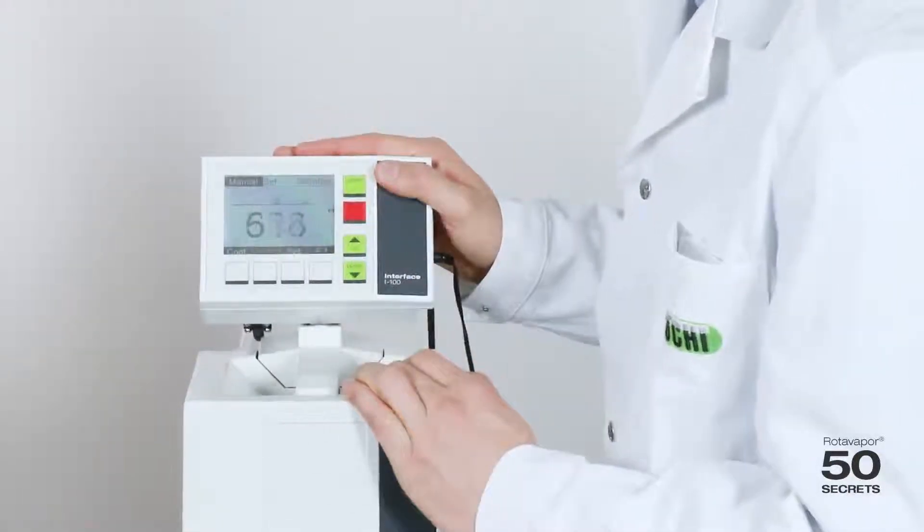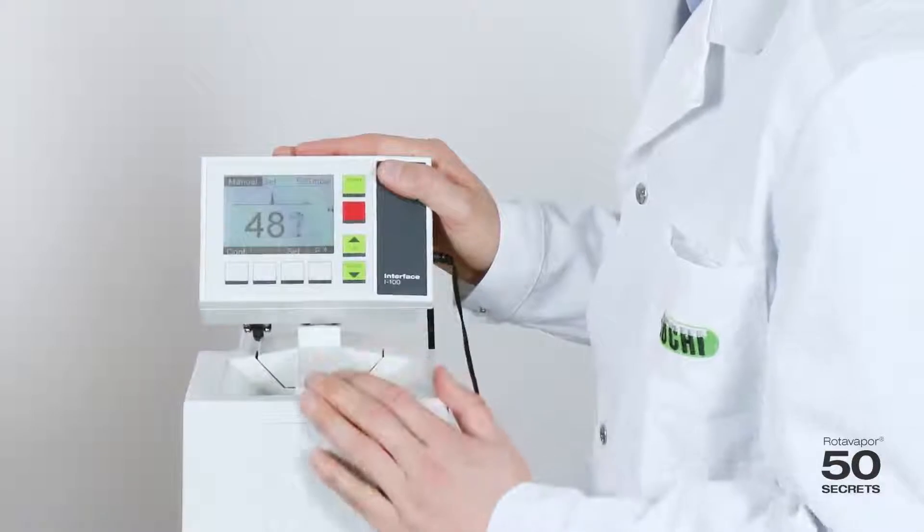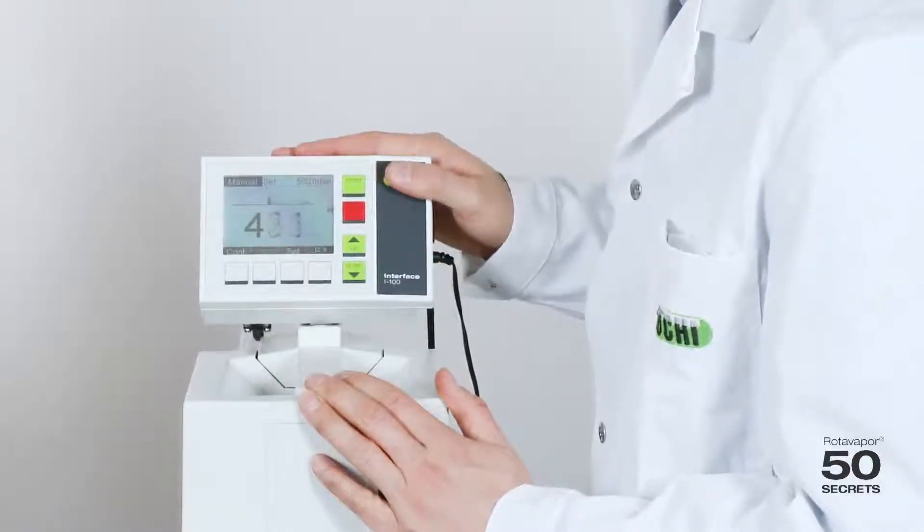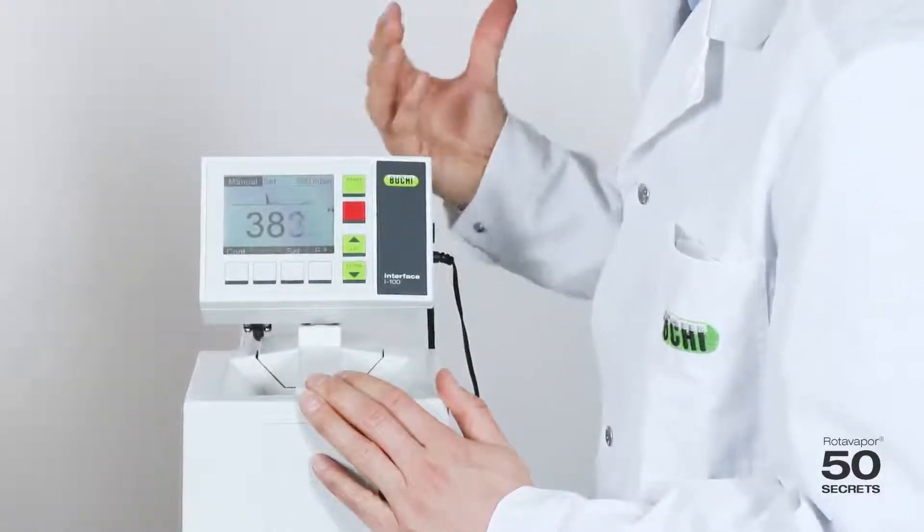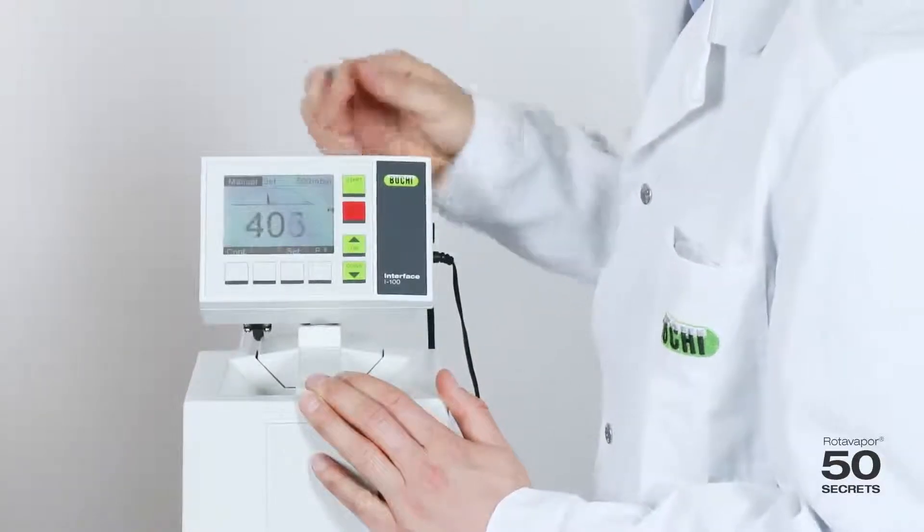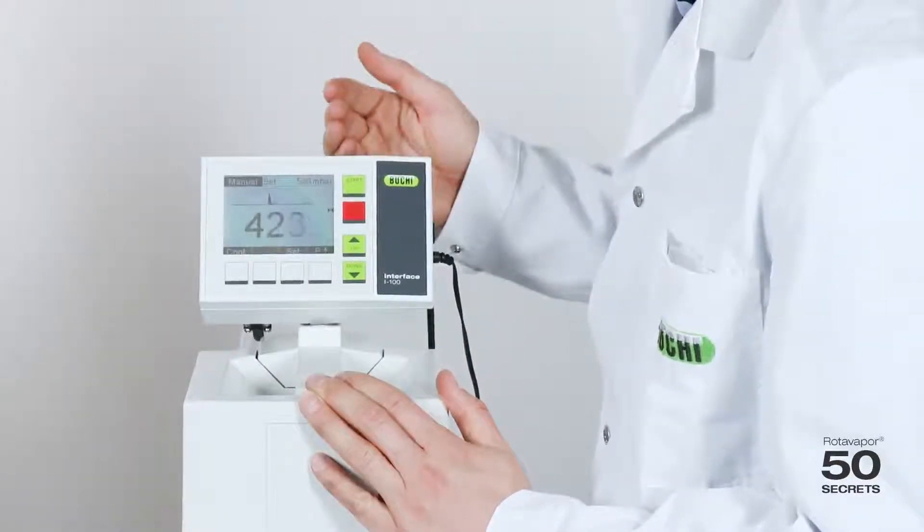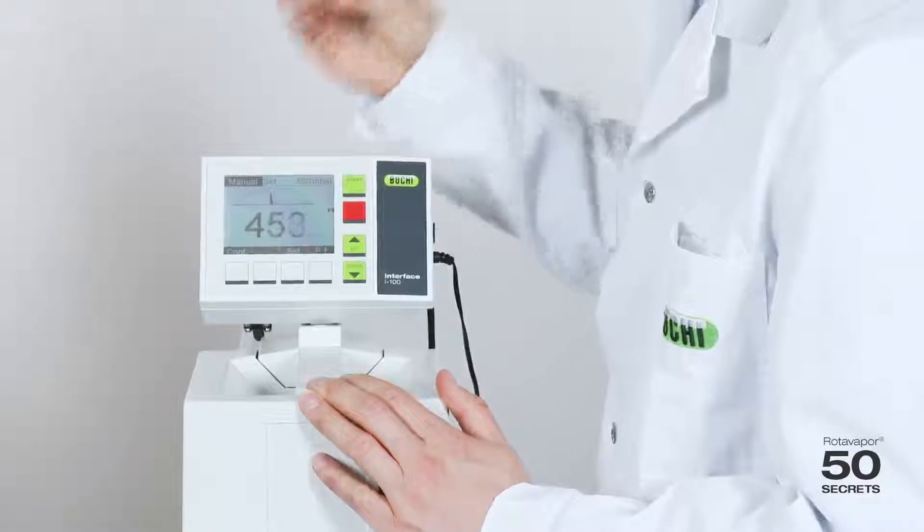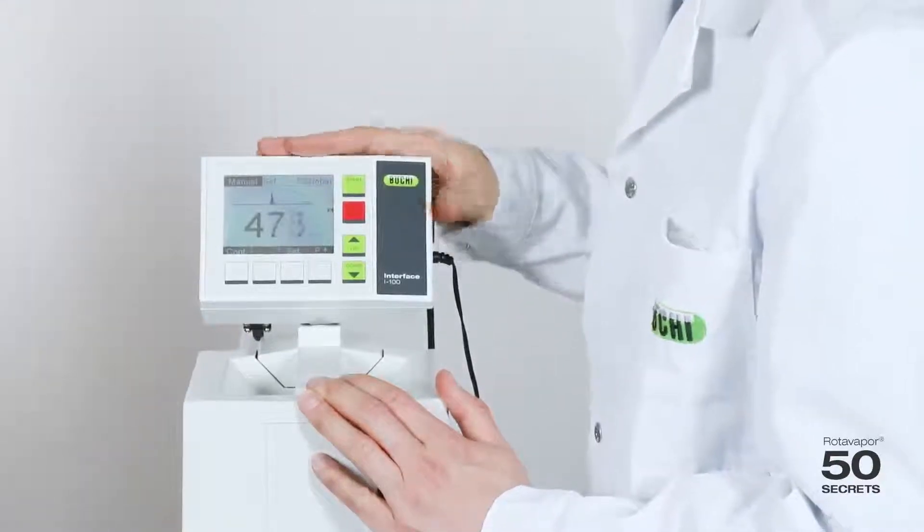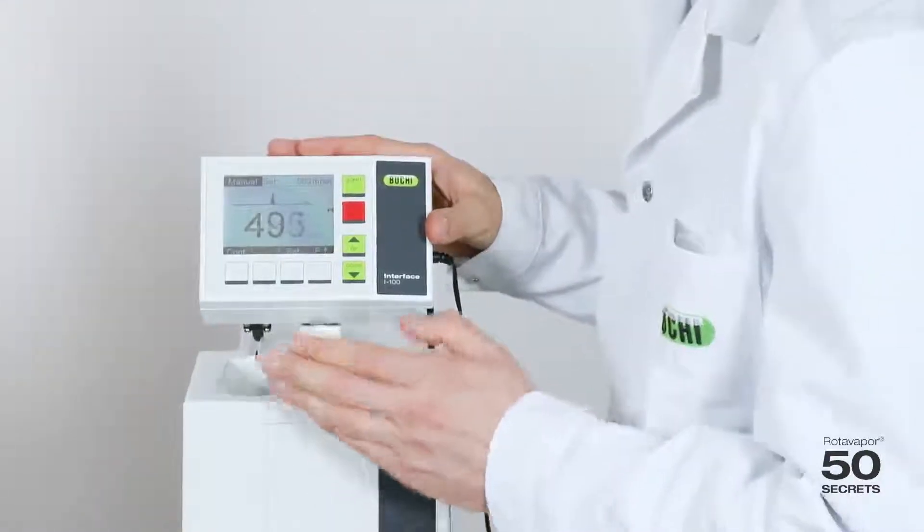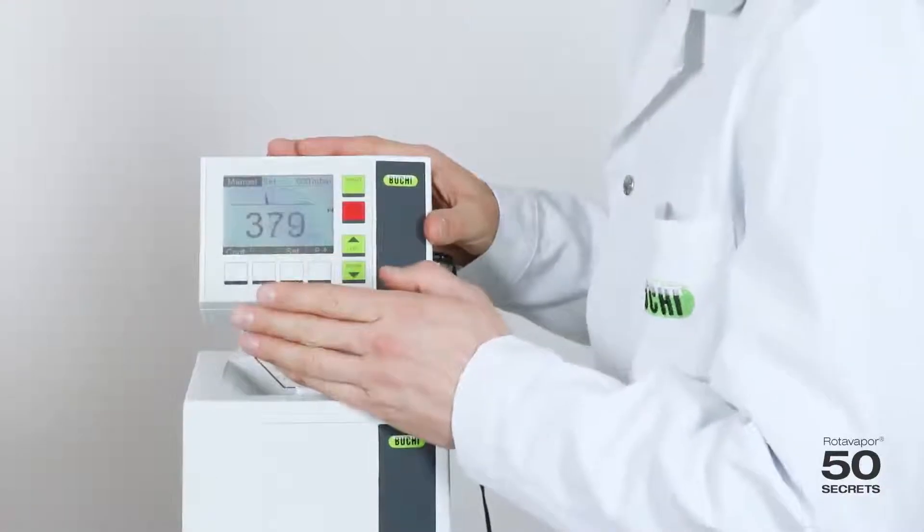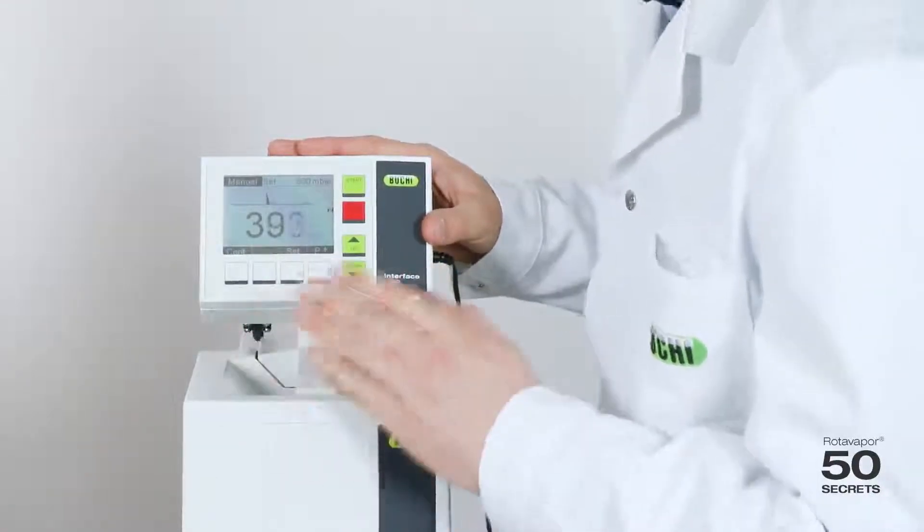It's pumping. It's a very small volume and you will hear the pump every now and then readjust to the vacuum. So you always hear a little and this is basically not speed controlled. It waits and then it does 100% of motor power and it goes back to zero.